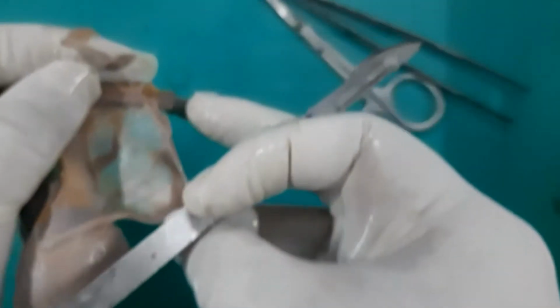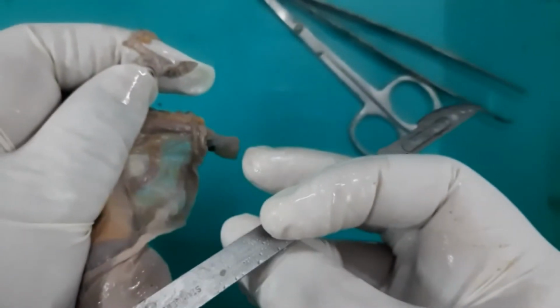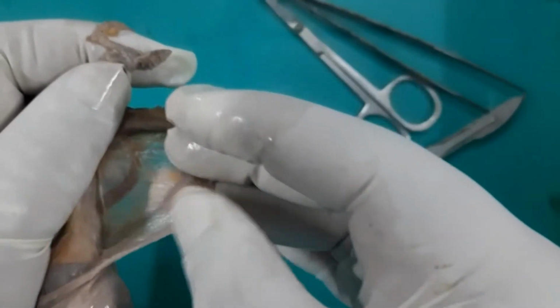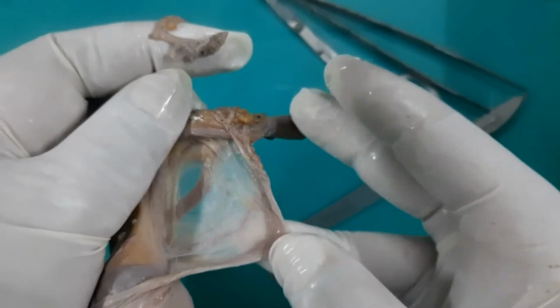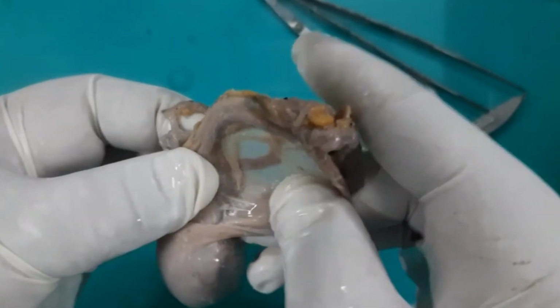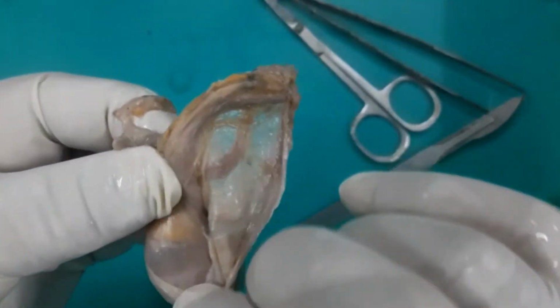Now I think you can see clearly. Yes, can you see this cremasteric muscle and the muscle bands here? This is the cremasteric muscle and the fascia. In between the muscle strands, there is the presence of the fascia. This is the cremasteric, which covers the whole of the spermatic cord and then the testes.